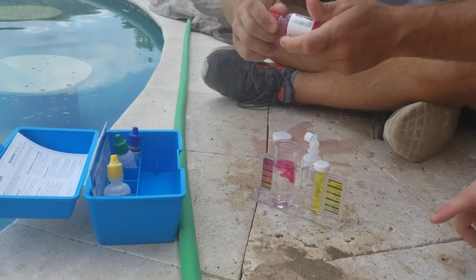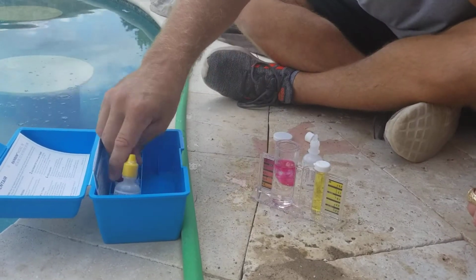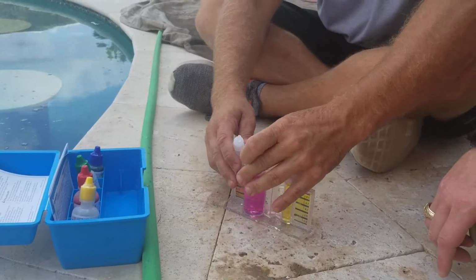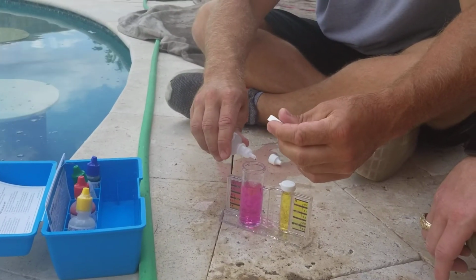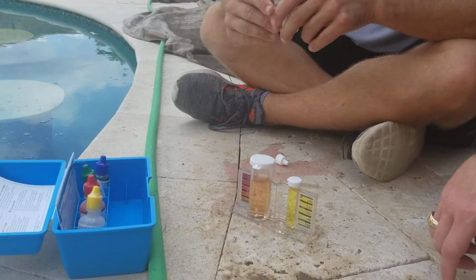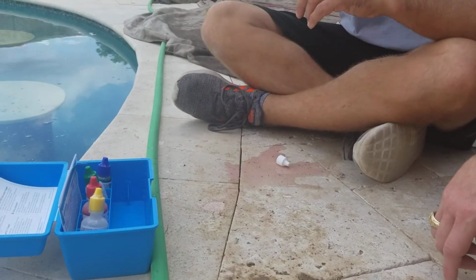And how often should I do this, every morning, every week? Once a week. We recommend getting your water tested. Okay, so that was 1, 2, 3, 4. That was, okay, 5. Yeah, it was one drop away, so 5.